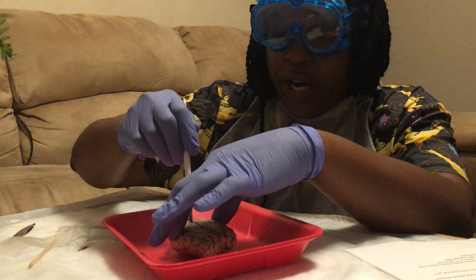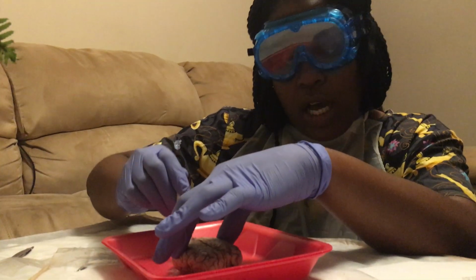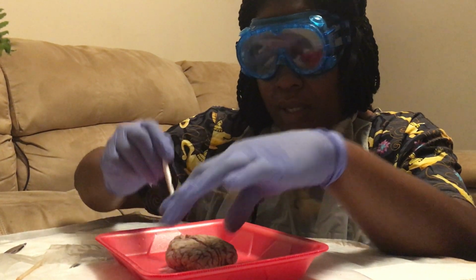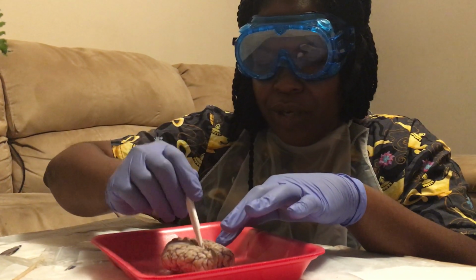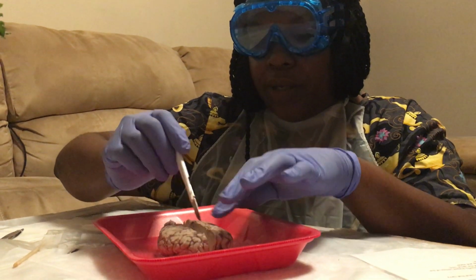This is very, very soft. The videos I watched, theirs were kind of hard. All right, so here we go.